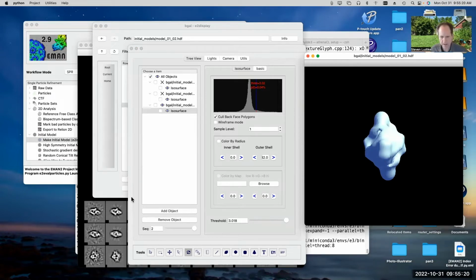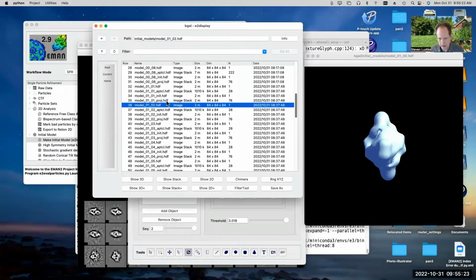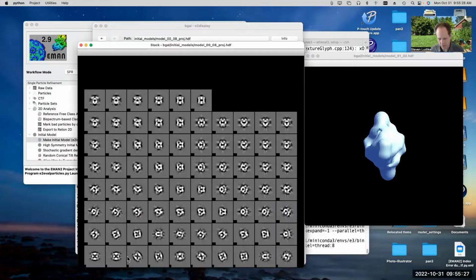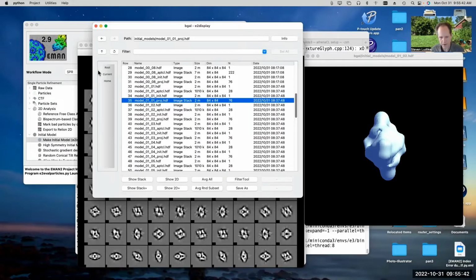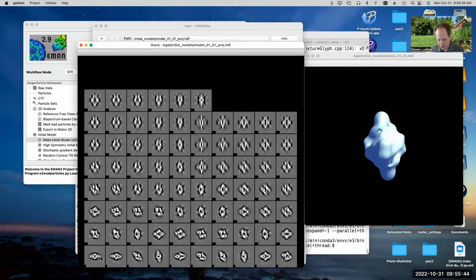So if we look at the projections, let's look at the projections from the one that I didn't like. So this is showing us projections in all different orientations. All of our particles should look something like one of these projections. Oh, sorry, that's 0, 0, 0, 8. That's the wrong one. That's the worst one from the previous round. This one. There we go. So all of our projections, or class averages, should look something like one of these. Now, the thing you'll notice is that some of these look very nice.